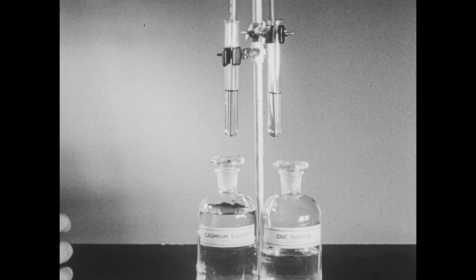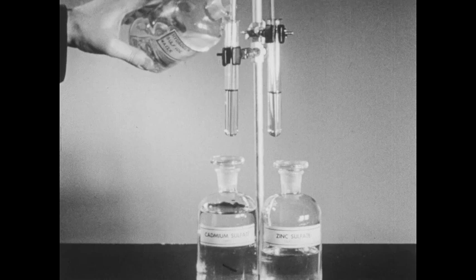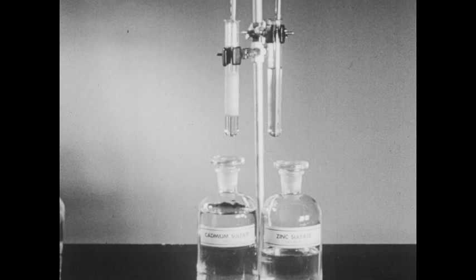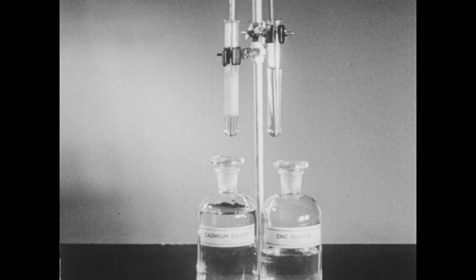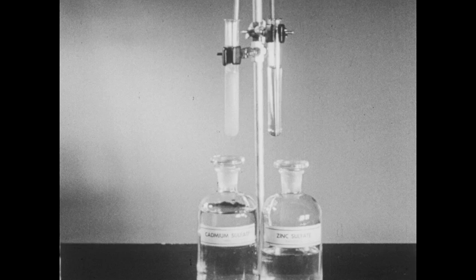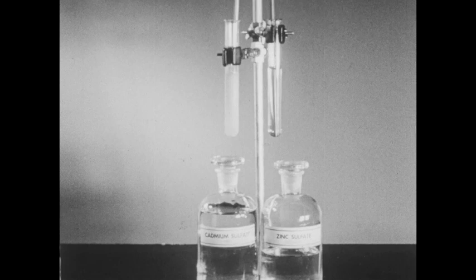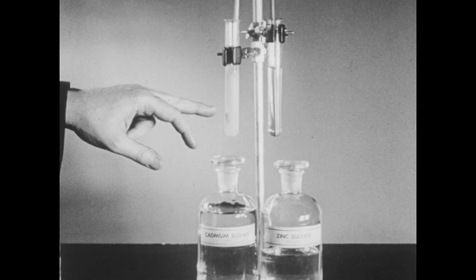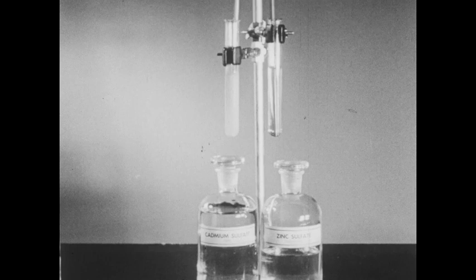To each tube we'll add our hydrogen sulfide water as before. The cadmium sulfide still precipitates, but no precipitate of zinc sulfide is obtained. This result is obtained because the presence of the hydrochloric acid has so reduced the ionization of the hydrogen sulfide that very, very few sulfide ions are present in the acidified solution — not enough sulfide ions to cause the precipitation of zinc sulfide. Cadmium sulfide, however, is so insoluble that an ample number of sulfide ions is present to cause it to precipitate.